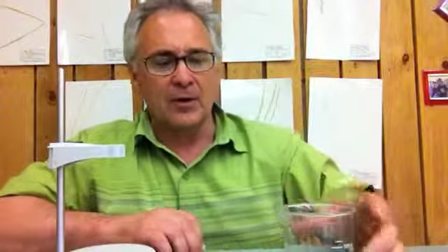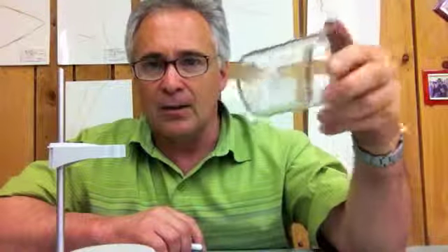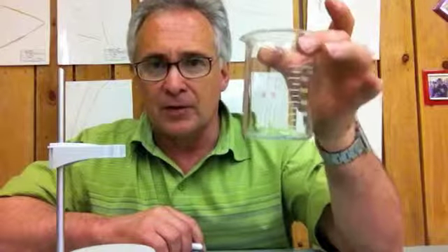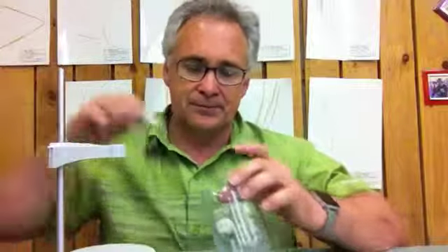Now the second part, you're going to start with that ubiquitous 200 ml or 400 ml beaker. Make sure, by the way, when you are finished with beaker number one, you rinse it all out. When you rinse it all out with the distilled water, we'll have a lot less residue left over. So anyway, you're going to take your beaker, make sure you have your magnet in it, and then we're going to set that aside for just a second.